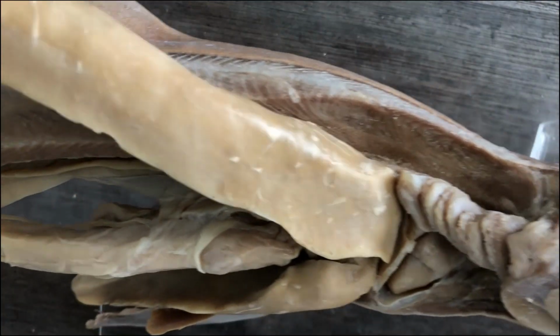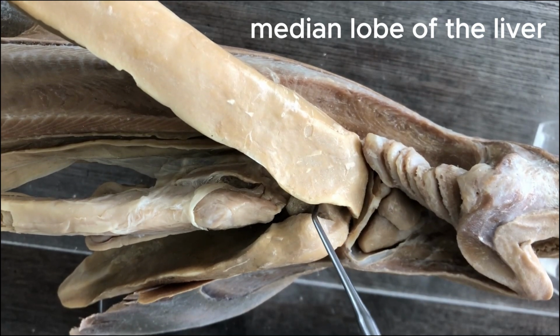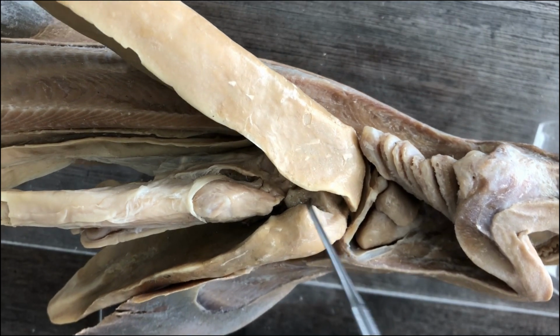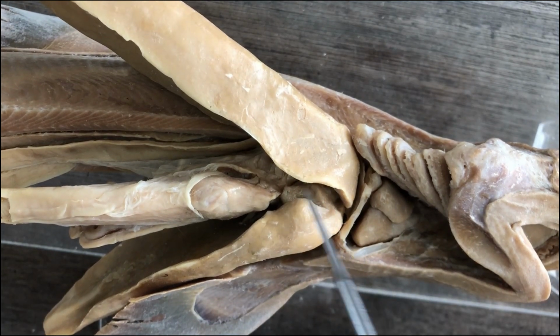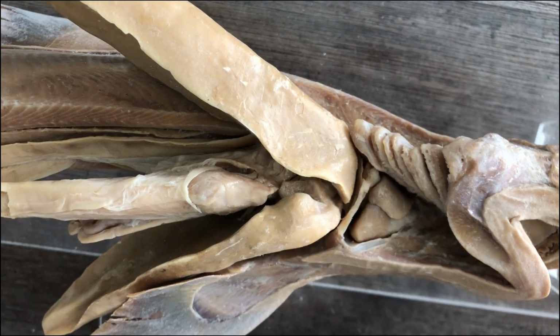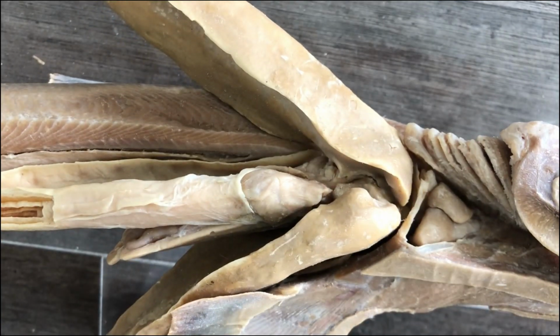And there's also a median lobe of the liver, smaller than these two lateral lobes. And then another prominent structure, but in this case it's covered by the liver, so I'll switch specimen.